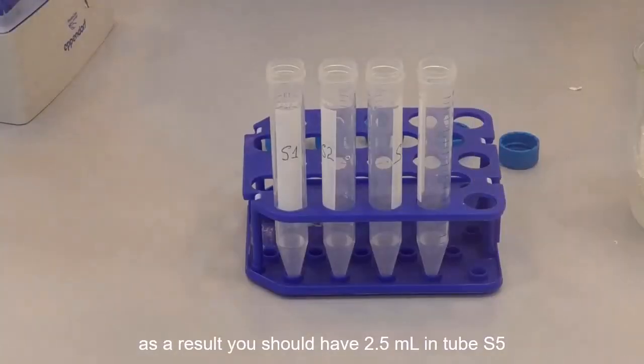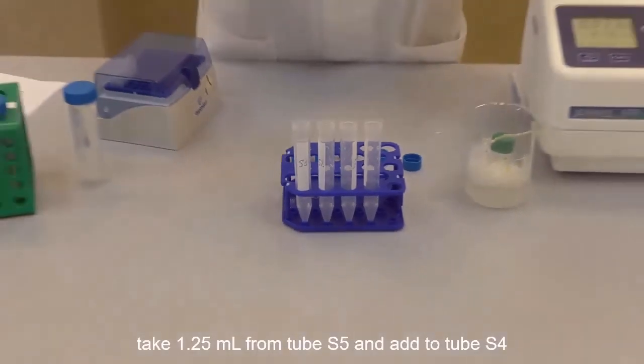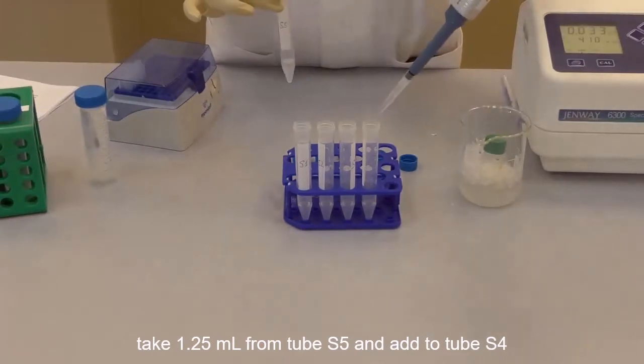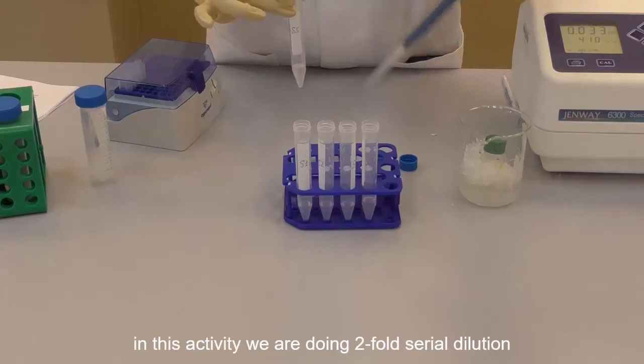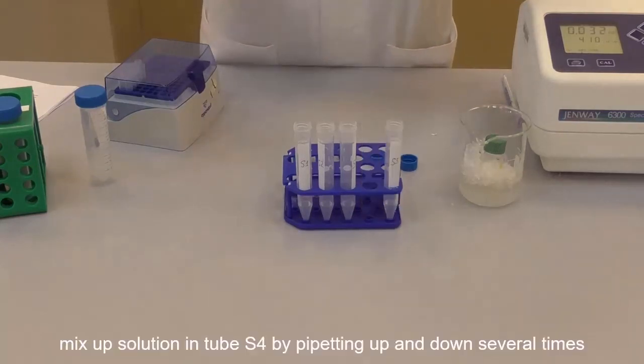As a result, you should have 2.5 ml in tube 5 and 1.25 ml of solution in the rest of the tubes. Take 1.25 ml from the S5 tube and add to the tube S4. In this activity, we are going to do the two-fold serial dilution. Now mix up the solution in tube S4 by pipetting up and down several times.